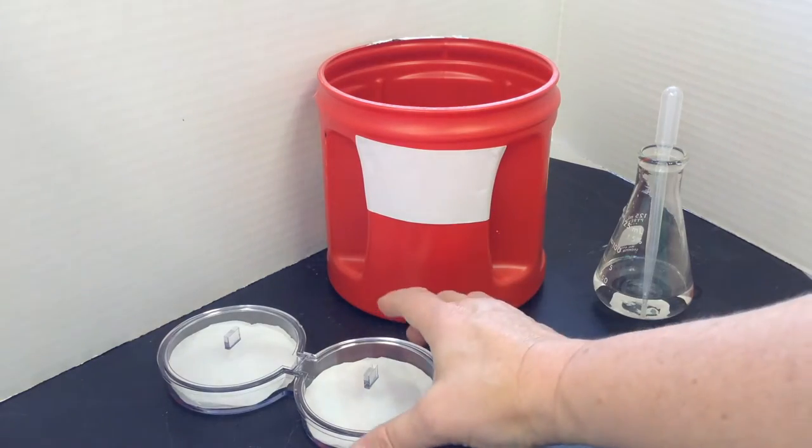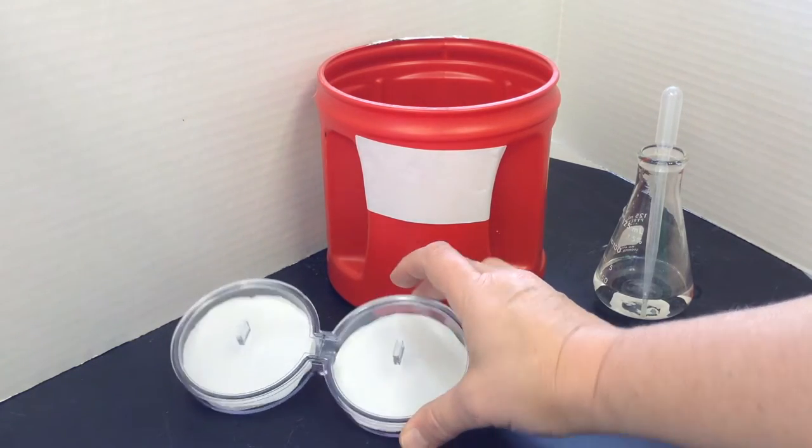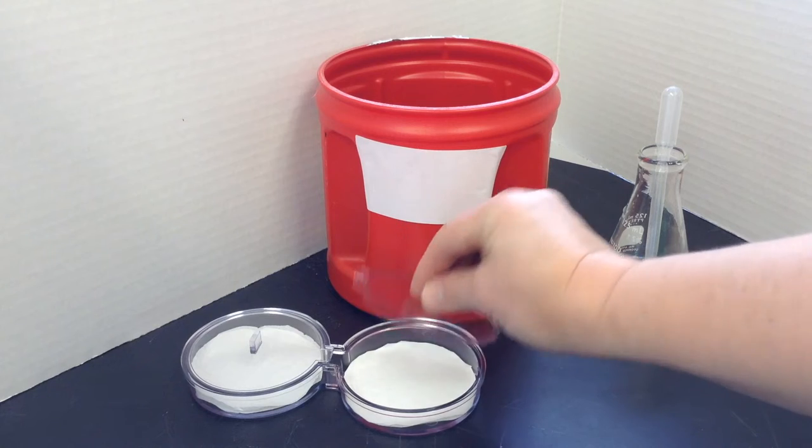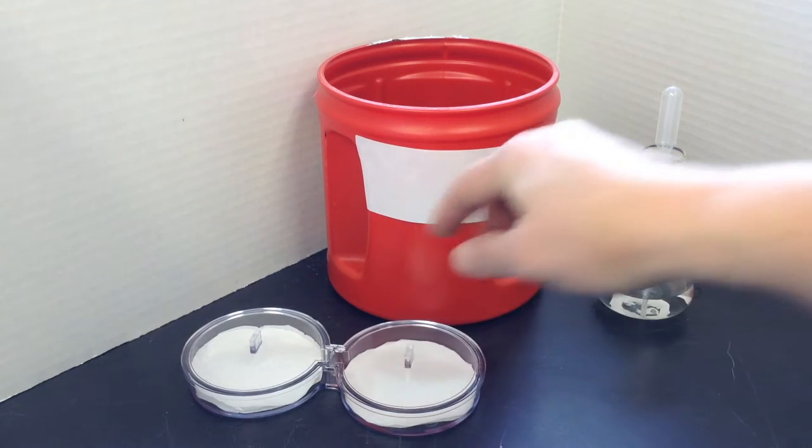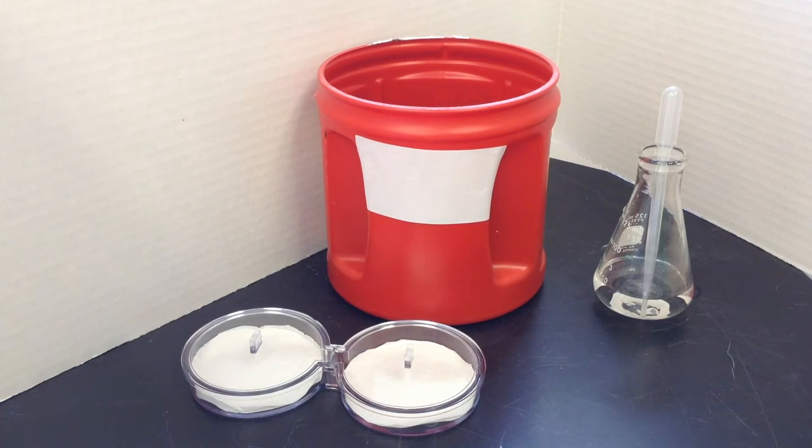So here we have our choice chambers. They're just two little dishes with lids you can take off, and you can put different things inside to give a choice to your test subject.